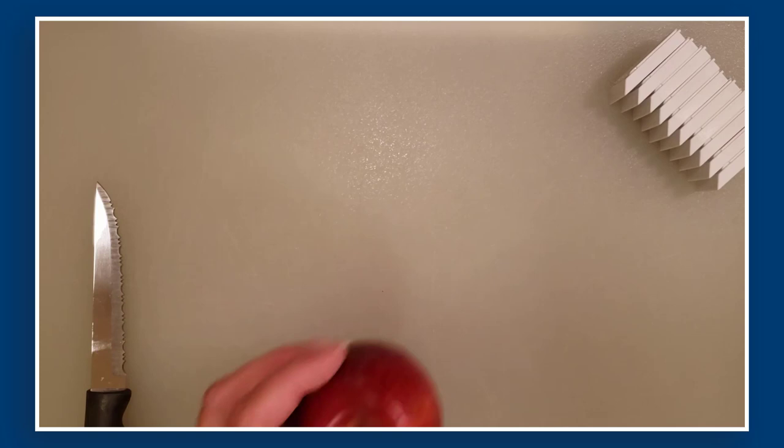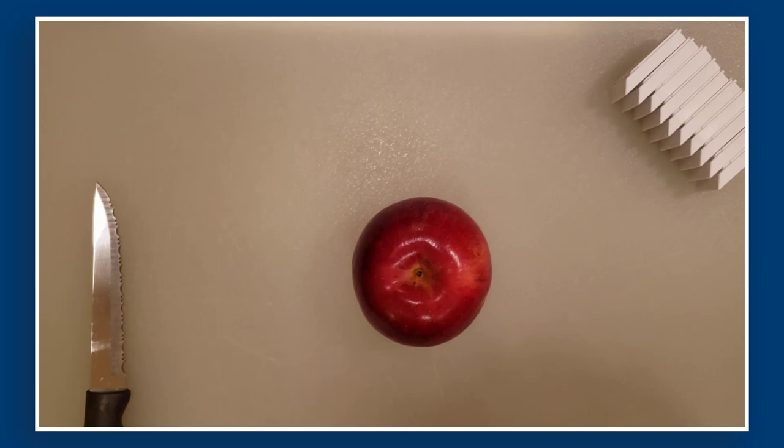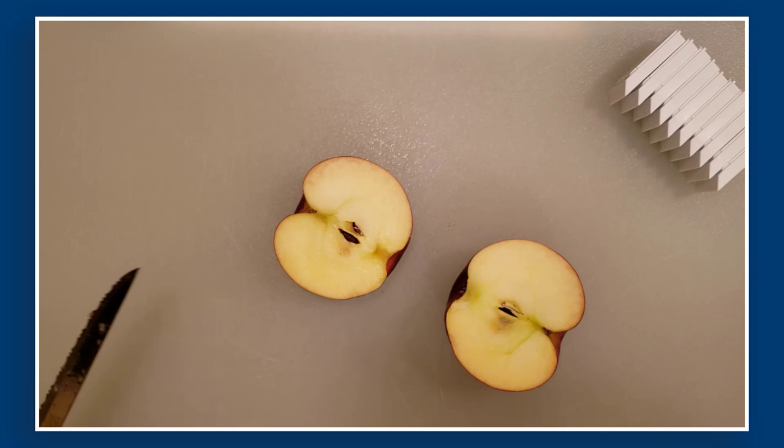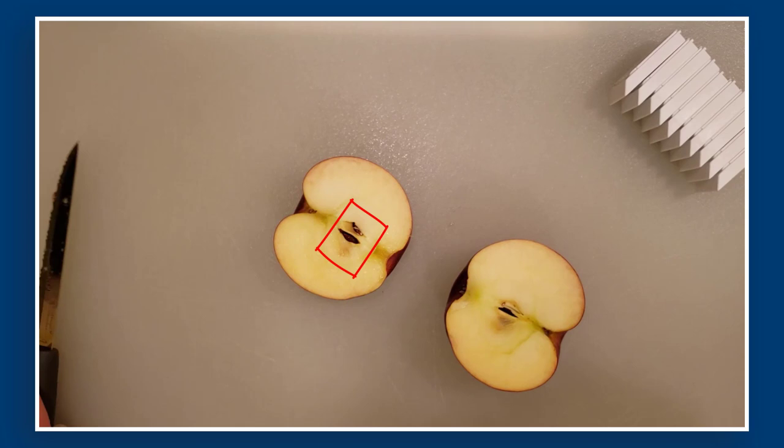What I'm going to demonstrate right now is we're going to take an apple and use this to figure out a little bit about histology sectioning. Cutting this apple open, we see we've got this one orientation. We've got the seeds inside, the pulp around it, and what we could do is just take a section of this area.